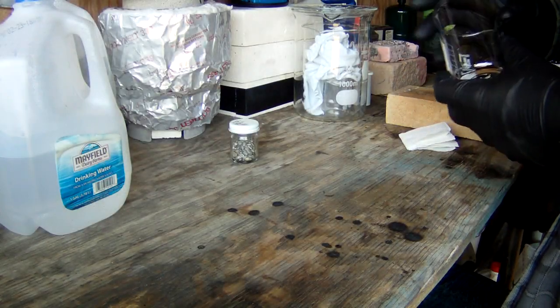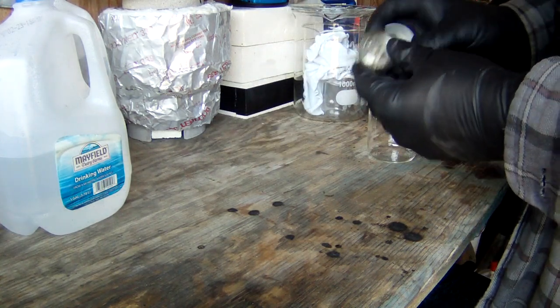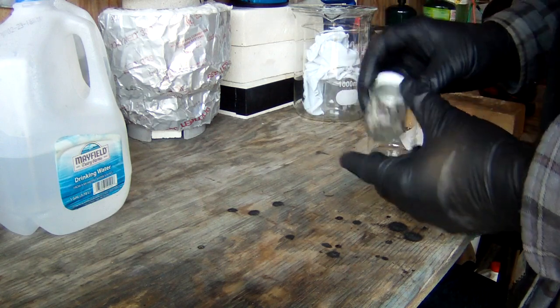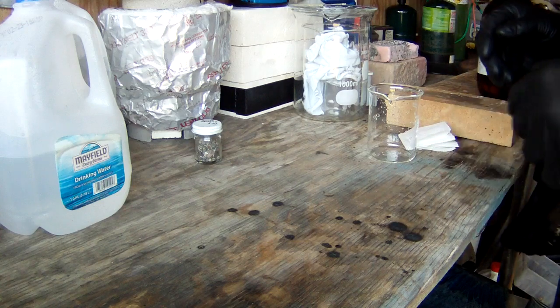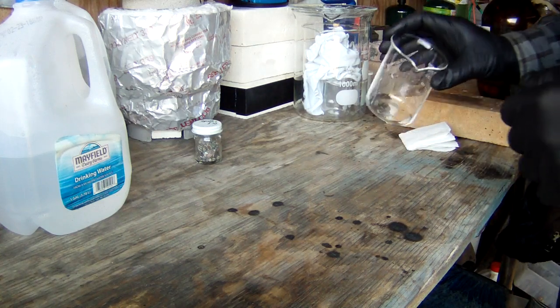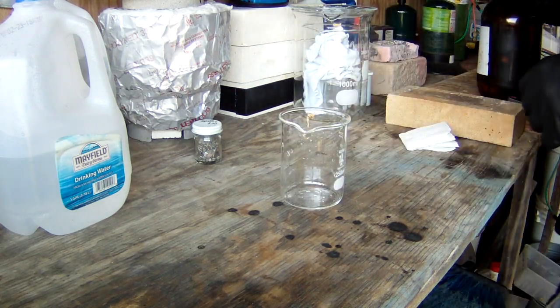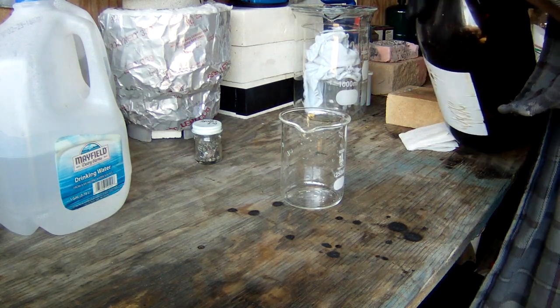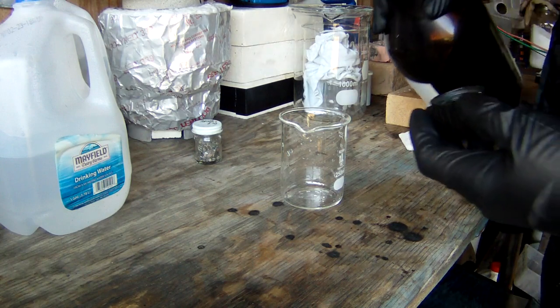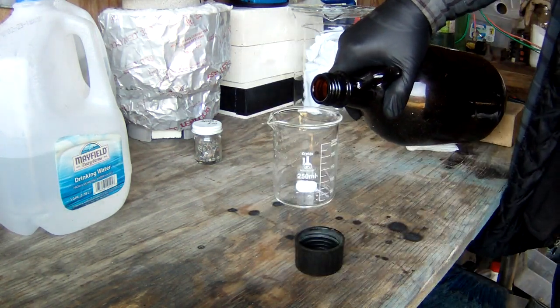Well, here we are with part 2 of Full Push Metals contact refined. So we got the contacts out here. I've actually got about 100 mils of distilled water sitting on a little warmer up there getting warm because it is pretty cold out here. I'm going to go ahead and get us 100 mils of nitric acid to start with. It may take a little bit more. I figured about 115 milliliters, but we're just going to get 100 out for right now.